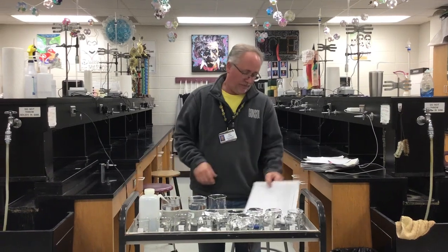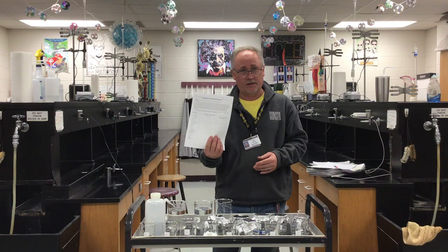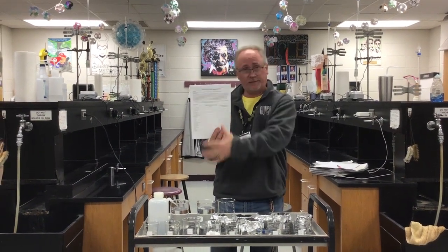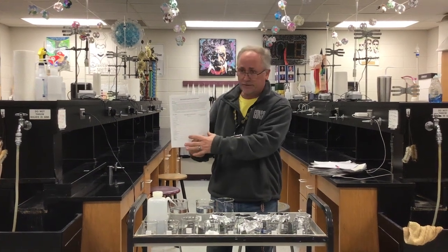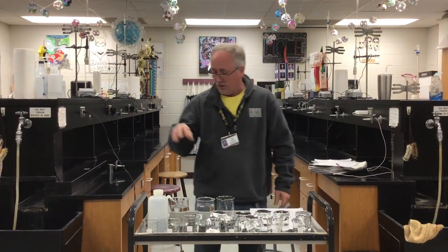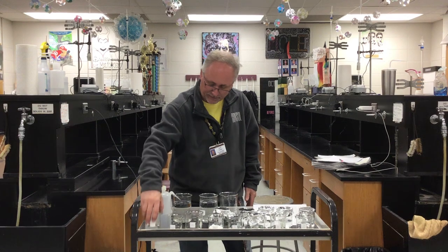Okay, so advanced chem students, this is going to be a demonstration of your electrolytes and non-electrolytes lab. So if you'll get this paper out, if you don't have it, go ahead and print it. But you're going to write all your data here on the front and then answer the questions on the back. Let's get started. So I've got a list here starting with 5% NaCl solution.